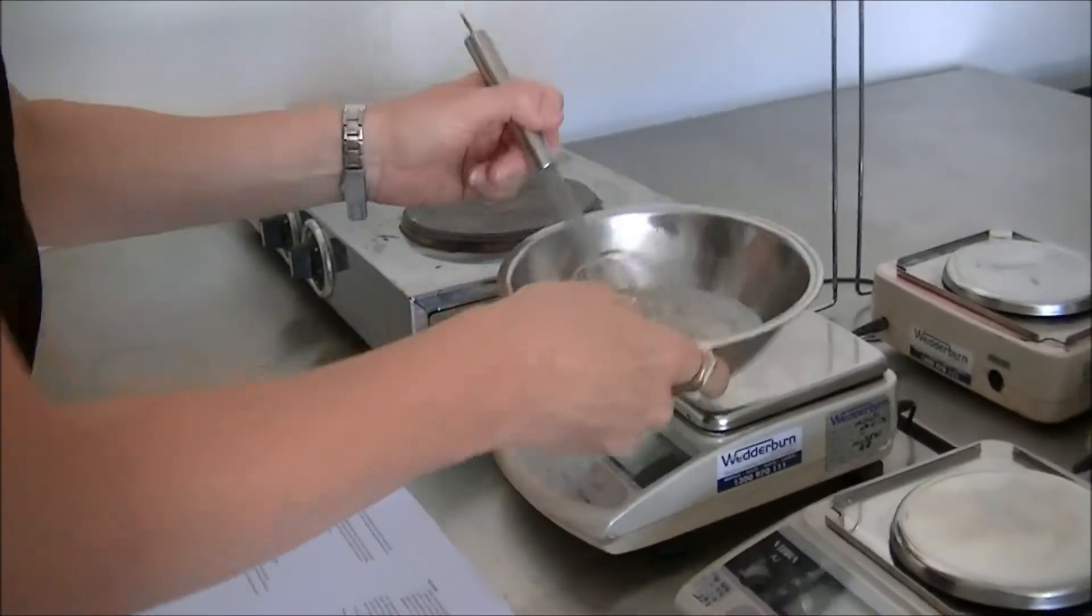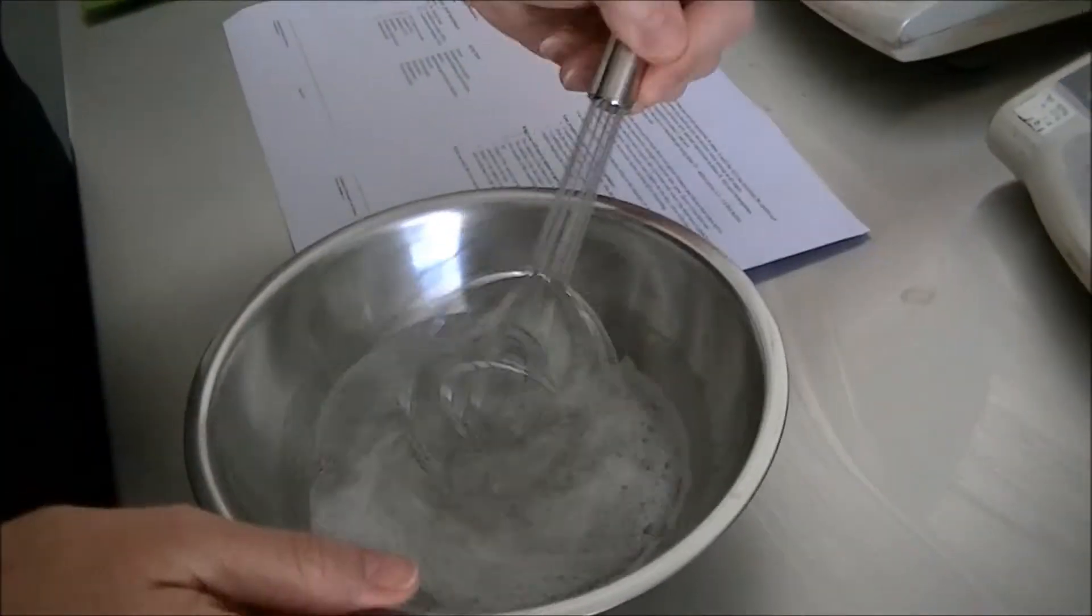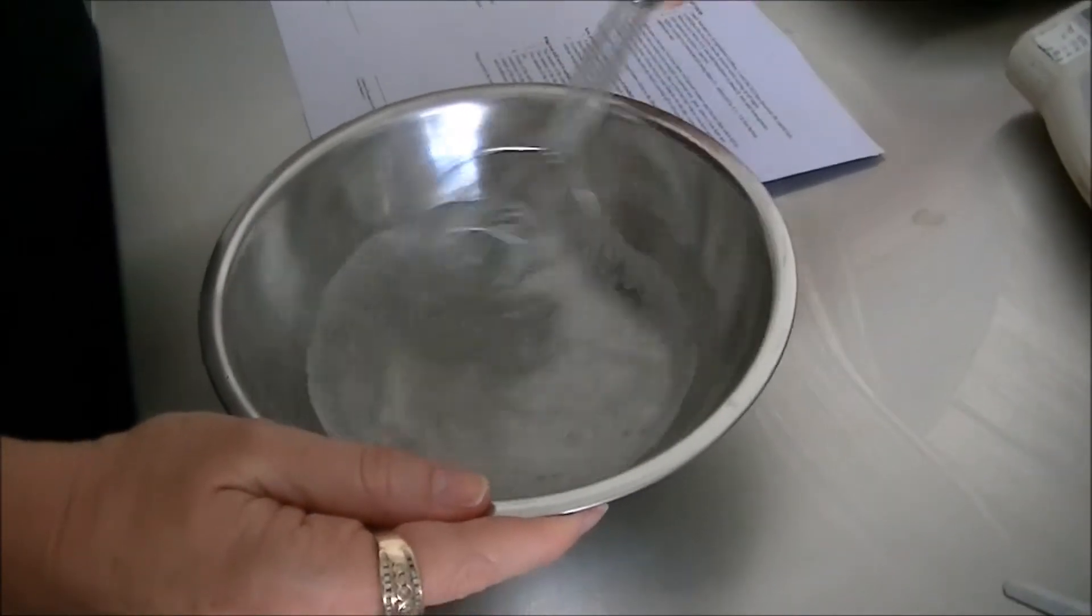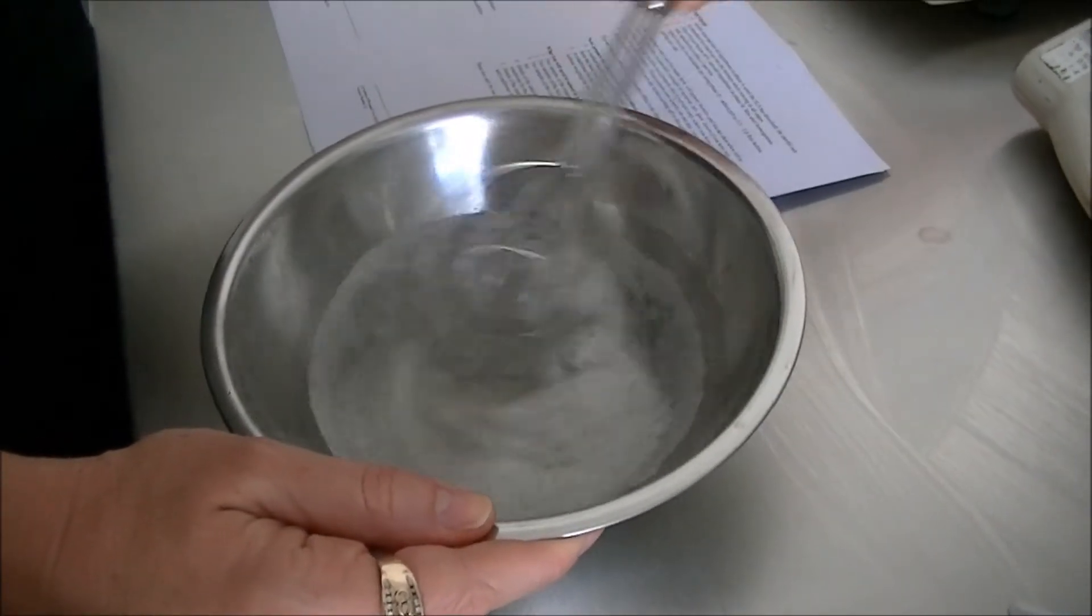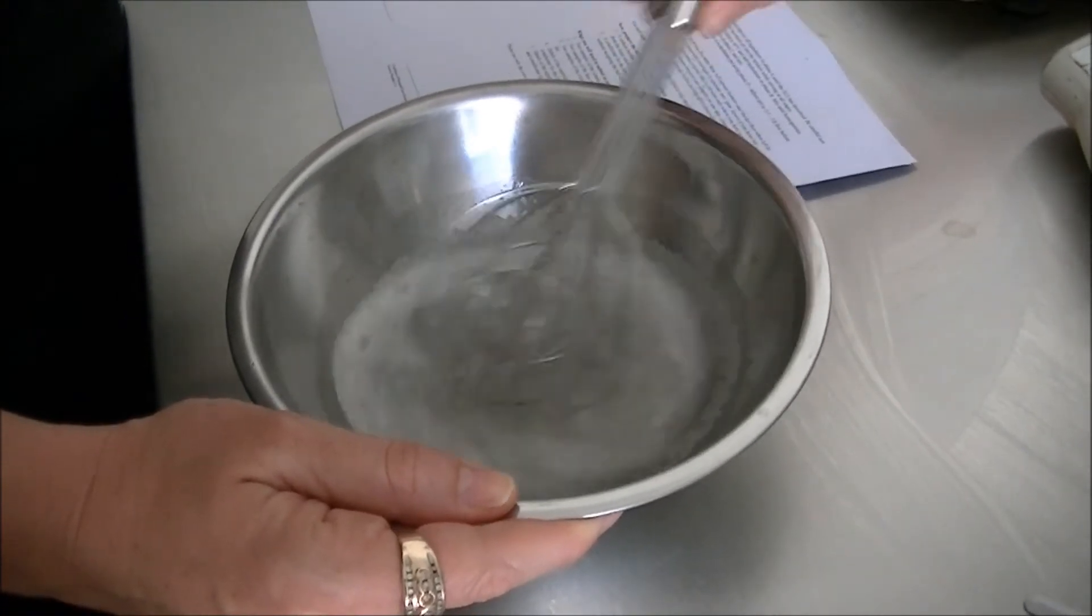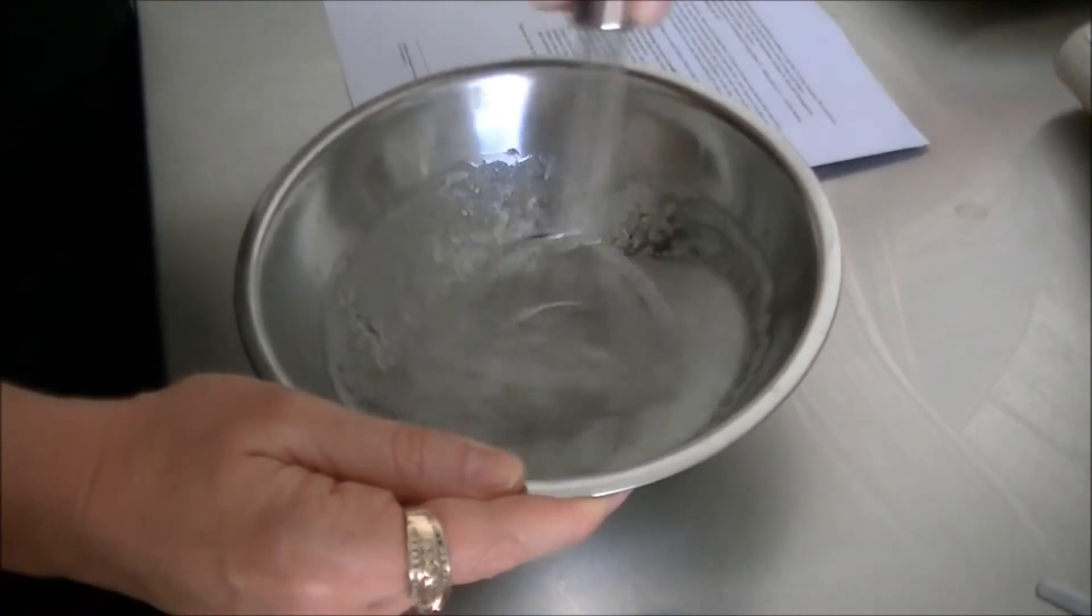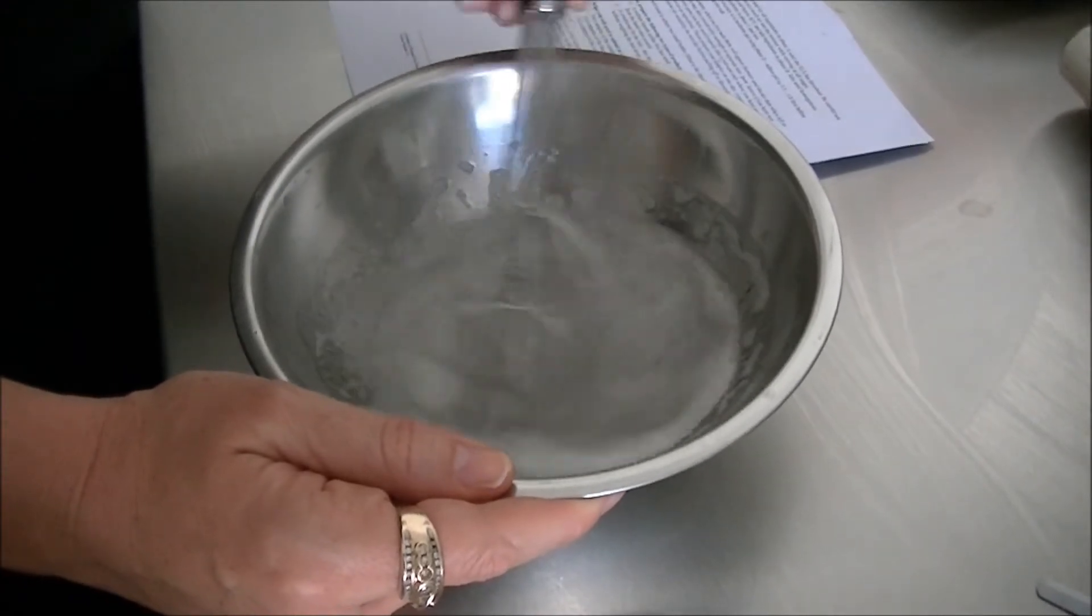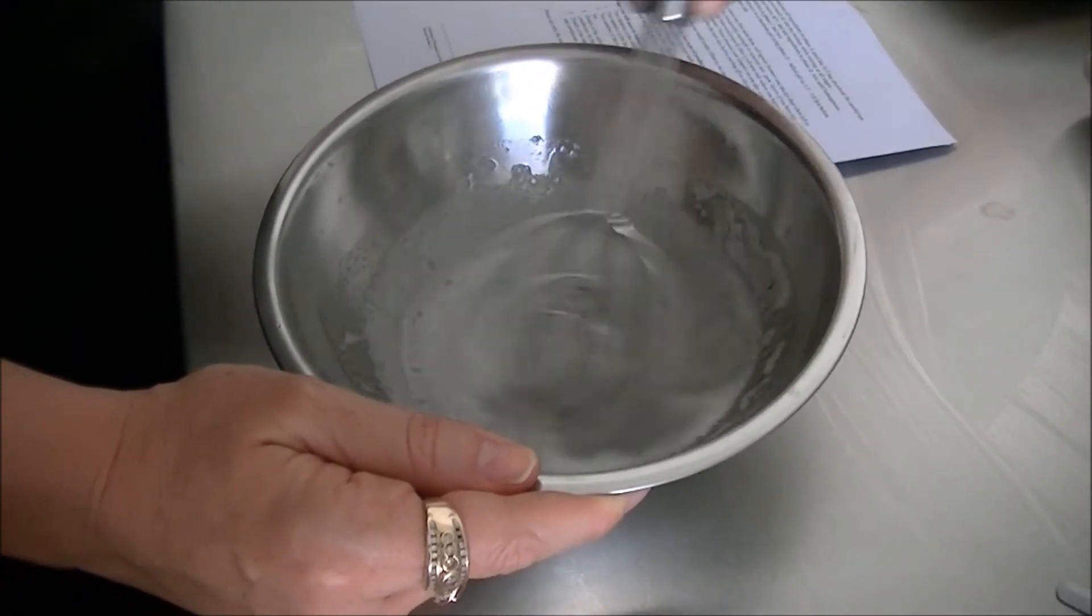And again I'm going to stir relatively gently so that I don't get too many bubbles. But I do need to make sure that everything is combined homogeneously. That is evenly.